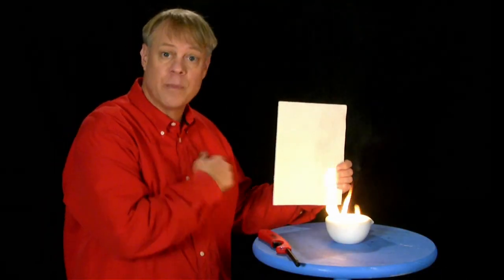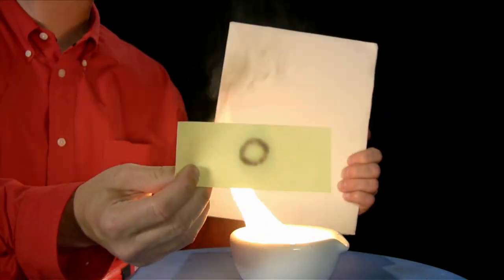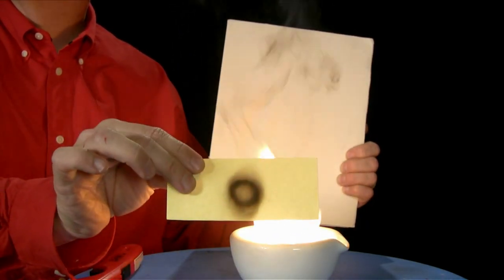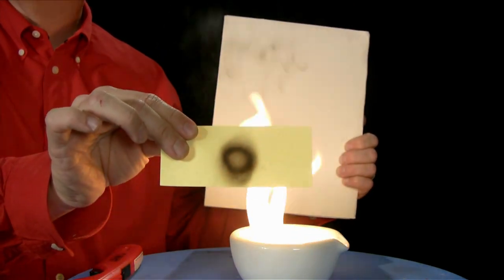Recall the charred ring on the paper, and on the other side, you see the burning of a candle produces the same kind of soot, charcoal or carbon.